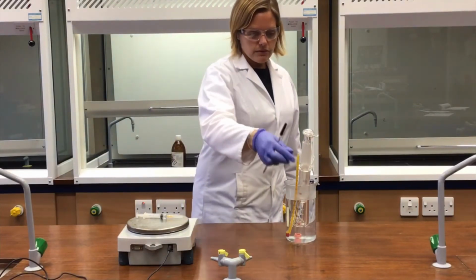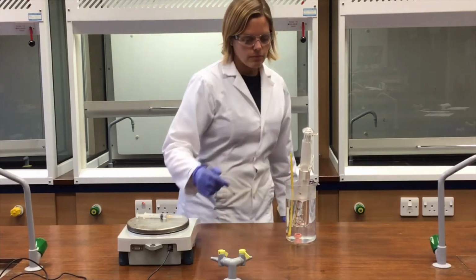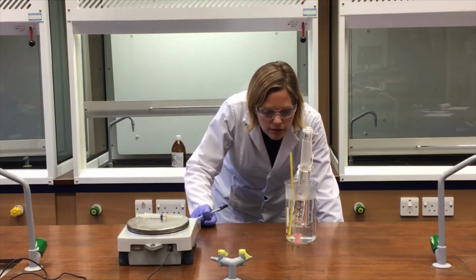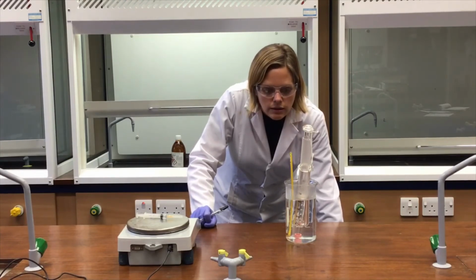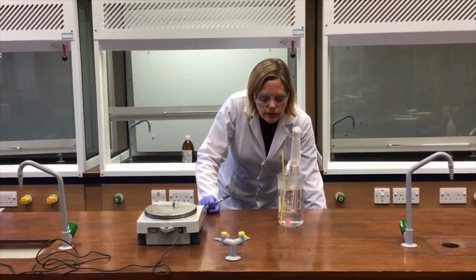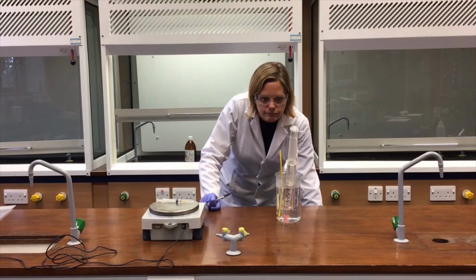The barrel of the syringe is still moving away. I'm just having a look at the thermometer temperature. The thermometer temperature is now at about 78 degrees C. This barrel of this syringe is moving nicely. I'm hoping that it slows down soon, because I may have injected a little bit too much hexane, in which case I've got to start again. It overshoots, but we shall see. It seems to be slowing down.